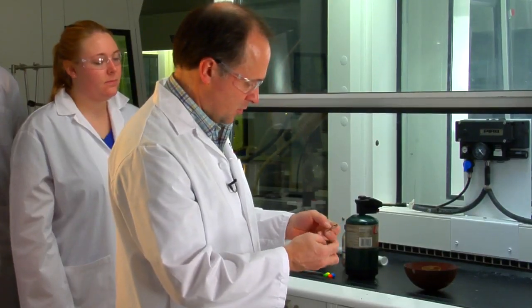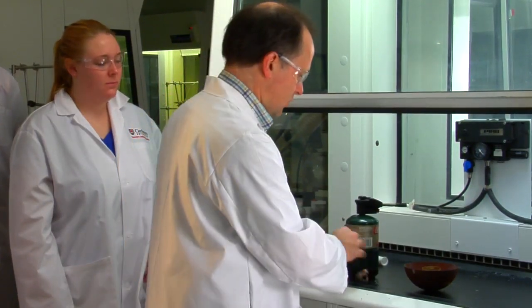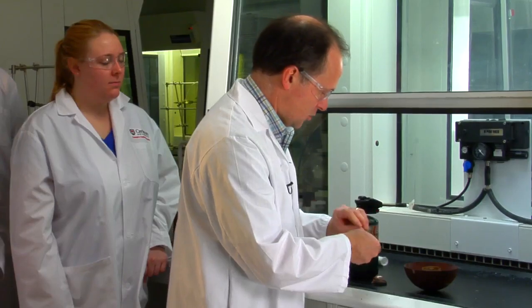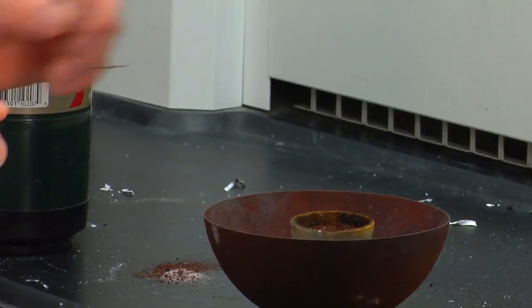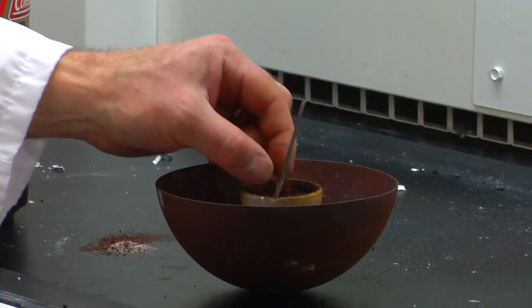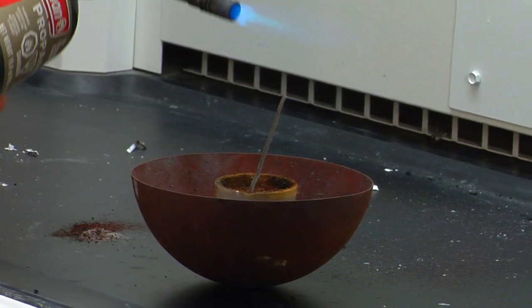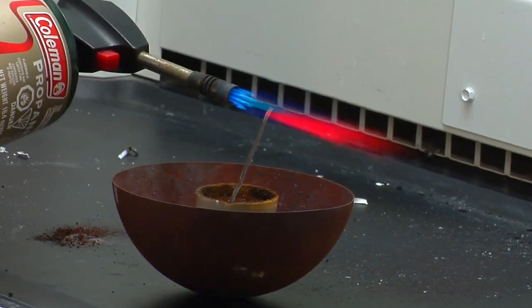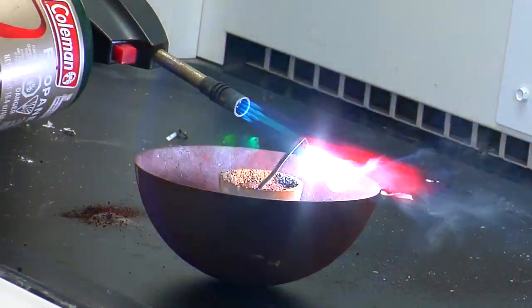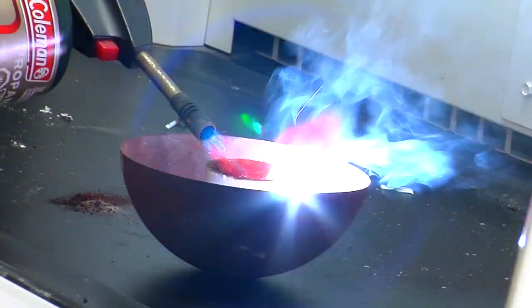So what I'm going to do is put a piece of magnesium into the thermite mixture. What we're going to do then is speed it up by heating it up, and you'll see that a lot of energy is released in a very short time.